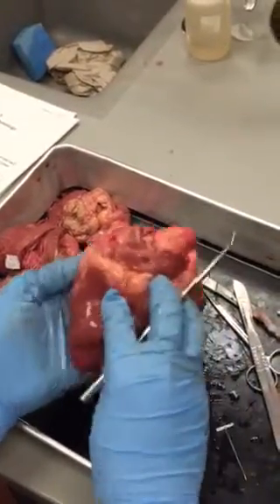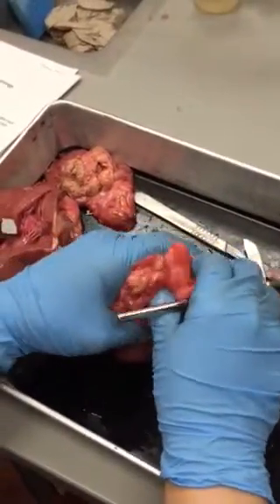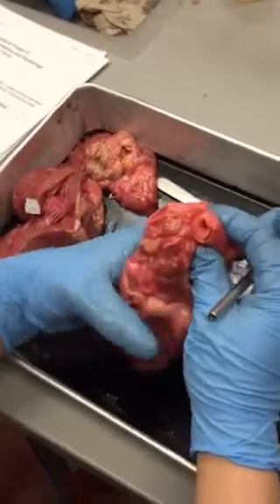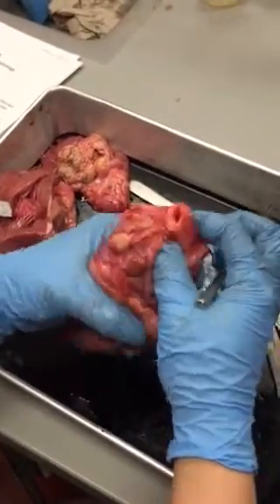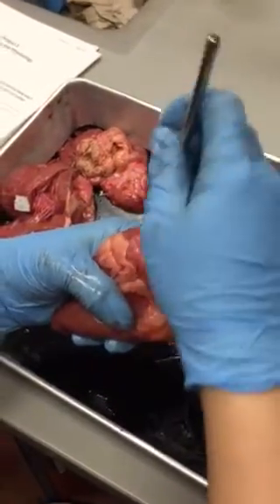This is one of the best ways to tell what vessel you are looking at: what chamber it's going into. And then again, you have 2 vessels going into each of the atria that you need to know, and those just look like a mess, so they're oftentimes very hard to find.